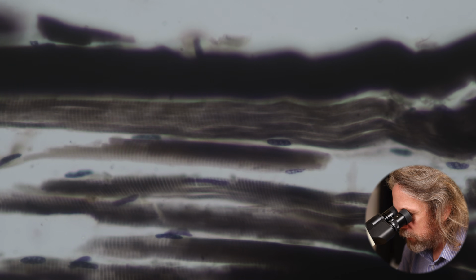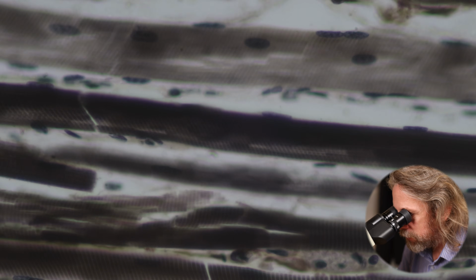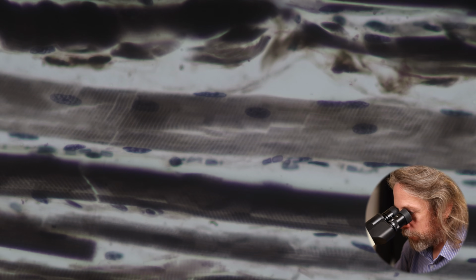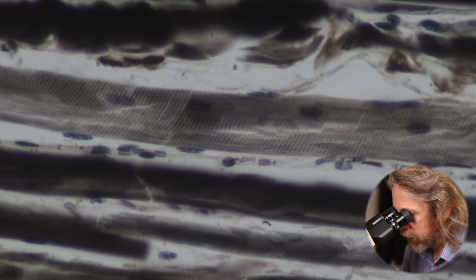Again, like all these videos, what I want to do is just kind of have a relaxed look around. Oh, that's quite cool. Rather than just showing you photos, the moving around hopefully helps you get a bit of the shape of the tissue in your mind, right? Kind of looks like a bit of shed snake skin, that. Okay, but that's it. That's skeletal muscle. That's what it looks like down the microscope.